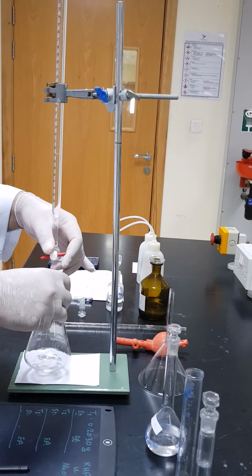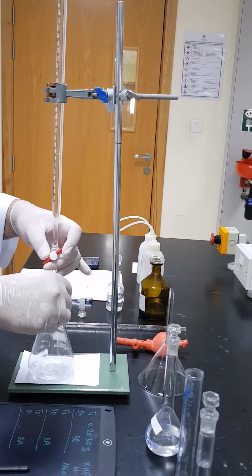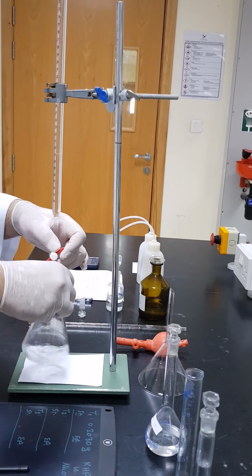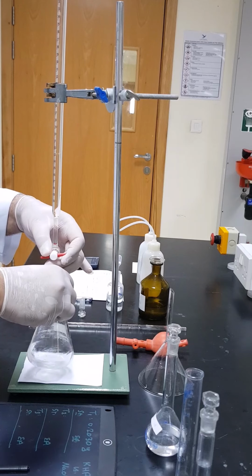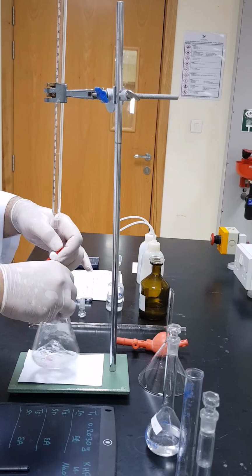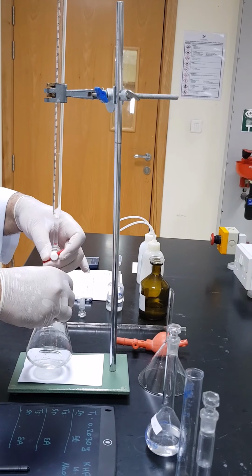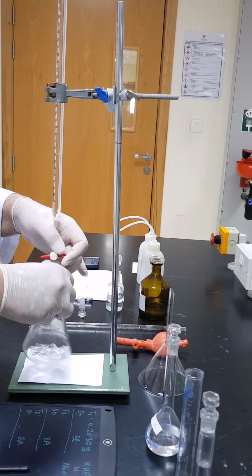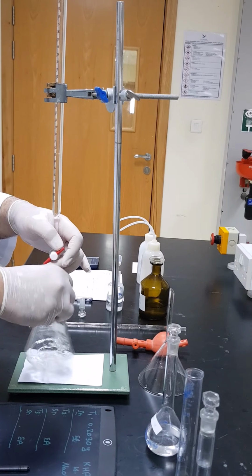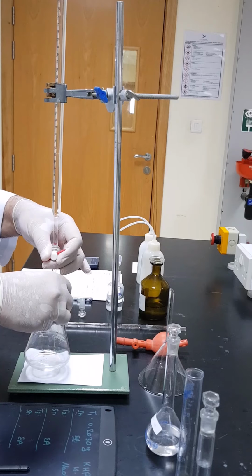Now it's 7 milliliters of sodium hydroxide. Now I'm starting to slow down drop by drop, so I will get the accurate endpoint. For sure, I have to make sure that I'm doing continuous shaking till the color changes. Now I can see that the color takes longer to disappear. So now I have to go very slowly to avoid over titration and exceeding the endpoint. Okay, one more drop.